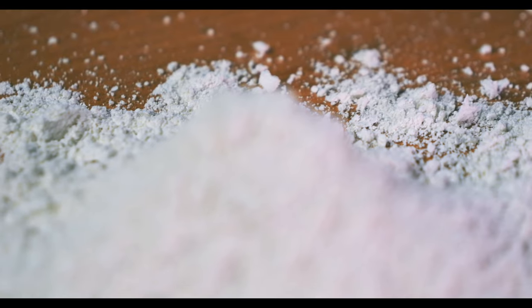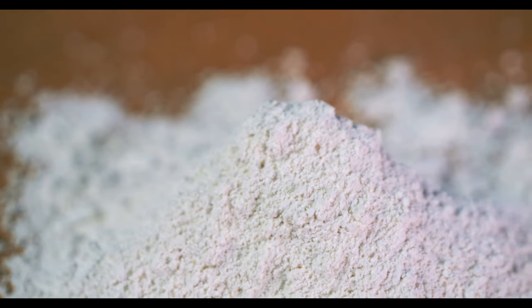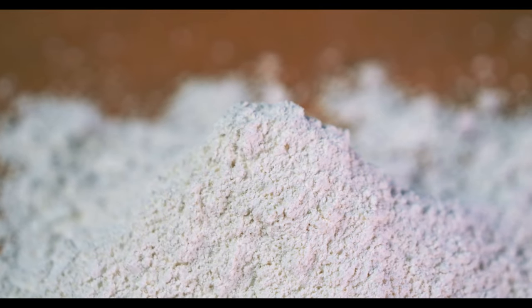If you suspect your particles are agglomerating because of static electricity, it's recommended that you lightly wipe the inside edges of the frame as well as the surface of the mesh screen with a dryer sheet. Burgess clay can also be added in small quantities to prevent static. However, you'll want to make sure you weigh the sample material with the Burgess clay prior to testing the material.